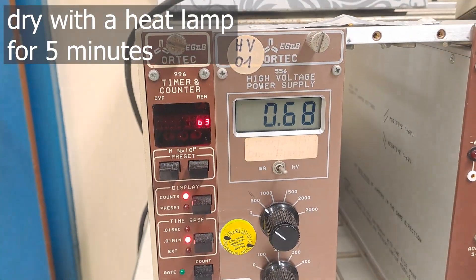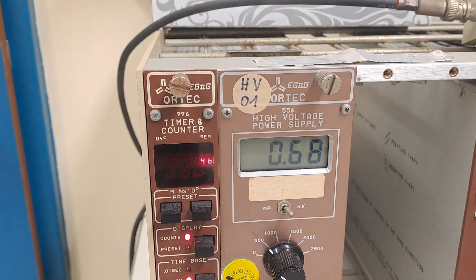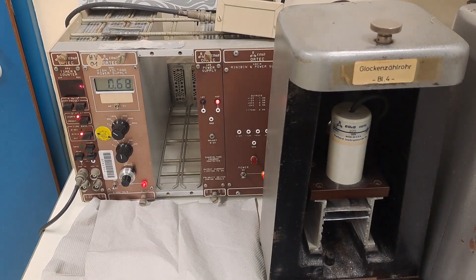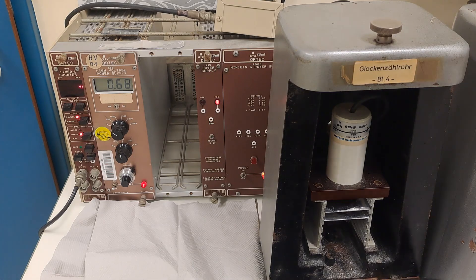Place a frame with household foil on the first slot, which is already prepared in the box for the lab day. Similarly, use the prepared frame with aluminum foil to shield the sample yet again.